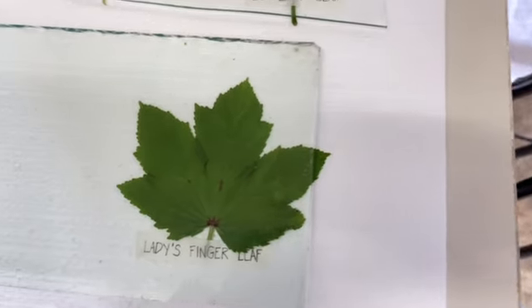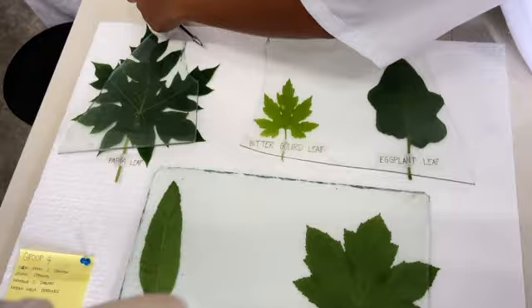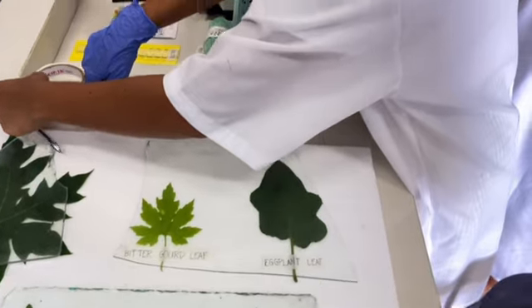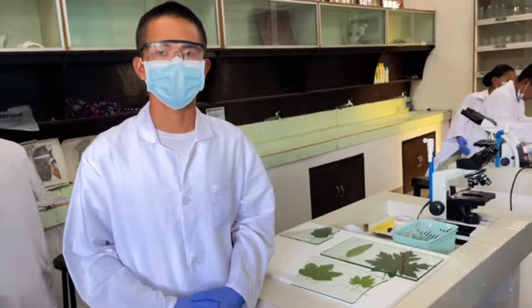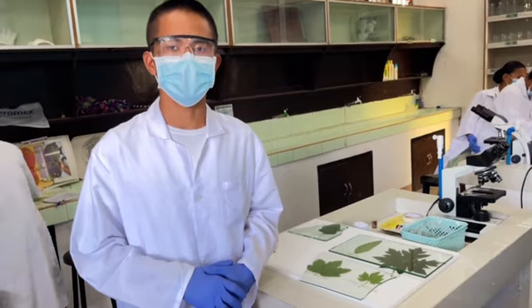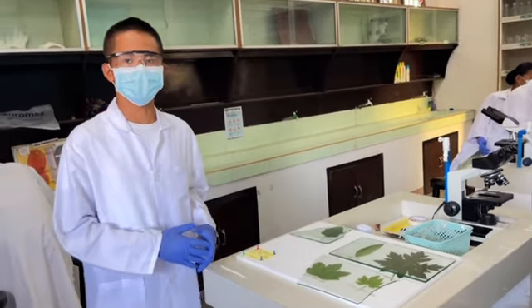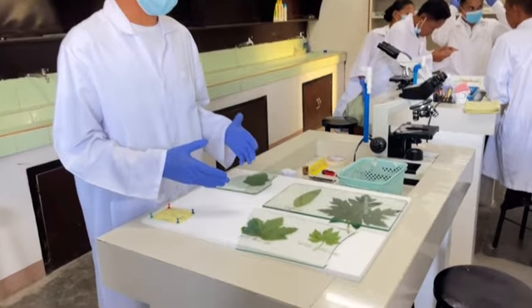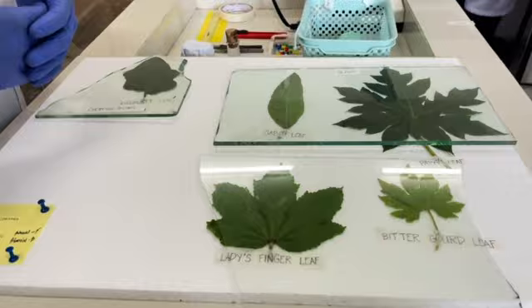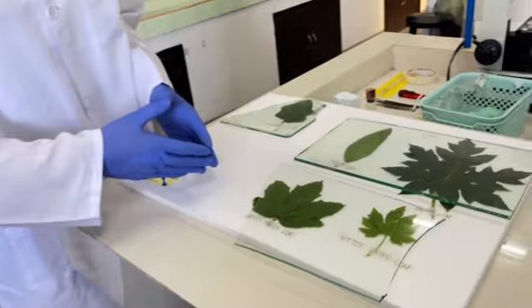In conclusion, understanding the substitutes and adulterants of Cannabis sativa is important for accurate plant identification in scientific study. Through careful observation and comparison, we learned that although many plants may look similar, the lady's finger leaf is among the most visually alike to cannabis leaves compared with the other leaves we observed. This reminds us of the importance of studying plant morphology closely before making conclusions.